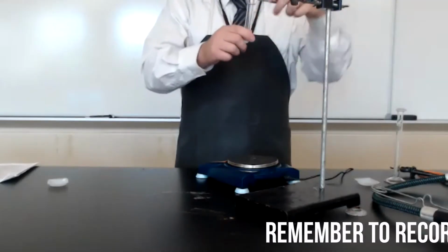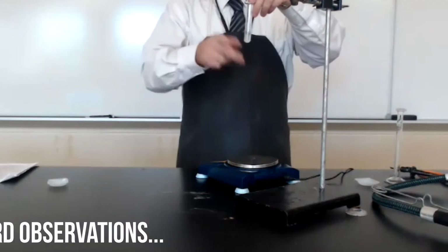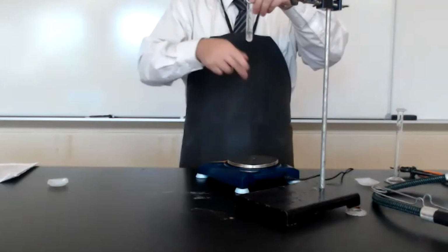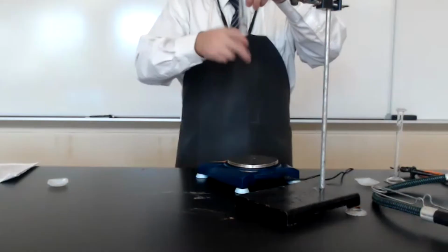To stir this, hold the test tube and tap gently on the bottom. Tapping gently will stir the solid into the solution. We are looking to dissolve all of the sodium chloride that we added.